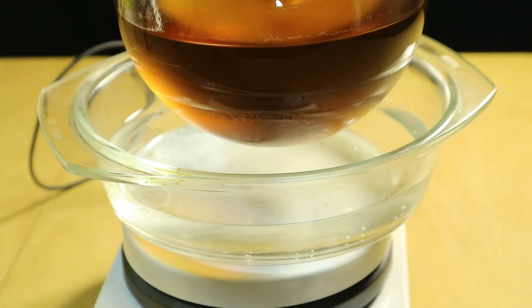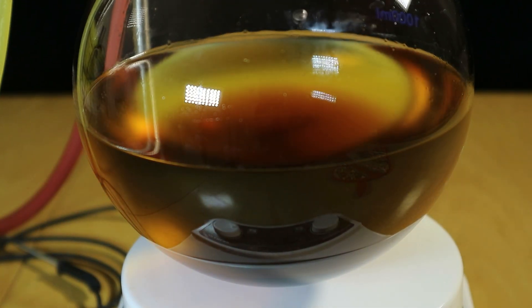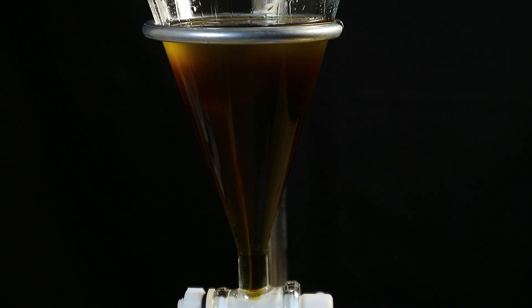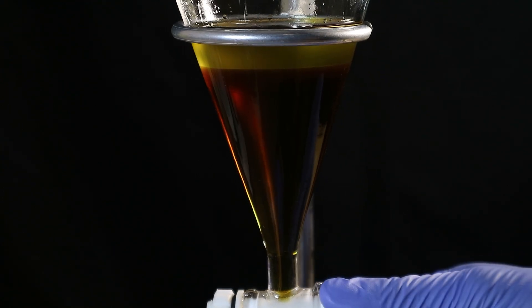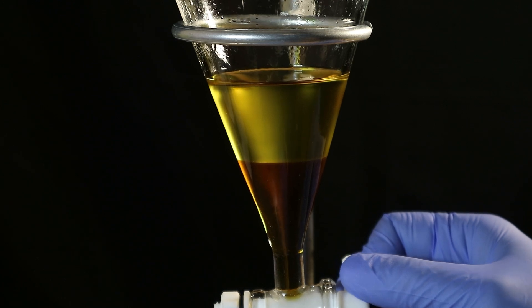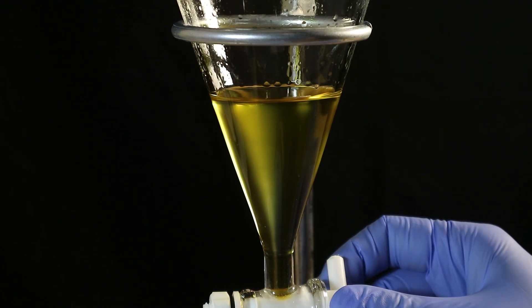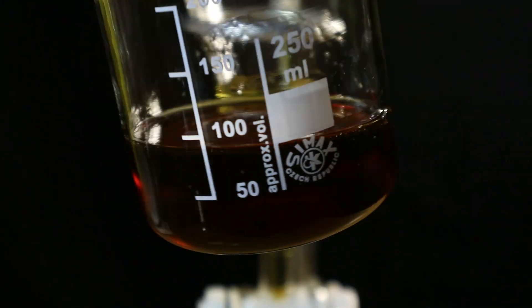I let the reaction go for around about three and a half hours, but in reality it seemed to have been finished earlier than that. After we let the product cool down and settle, we see that it forms two phases. Let's move it to a separating funnel and explain what's happening. The top phase is our product, the biodiesel — it is still contaminated with the potassium hydroxide and probably some free fatty acids and some soaps. The bottom phase is also quite interesting in its own right, because it's glycerin, basically. This is the backbone of the fats and oils that you find everywhere in life on Earth. It's a very sought-after ingredient in both the food and the pharmaceutical industries. So we can drain the bottom phase and maybe make a video about purifying glycerin later.